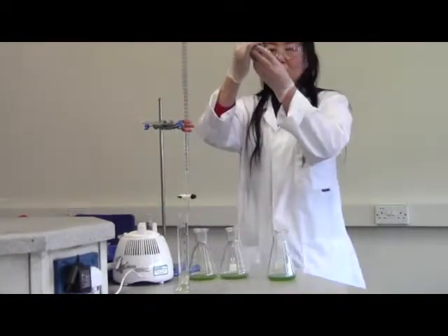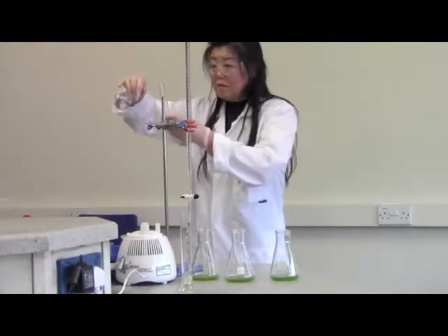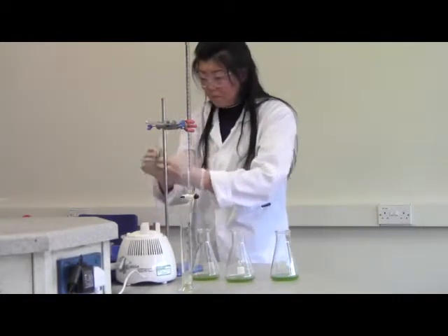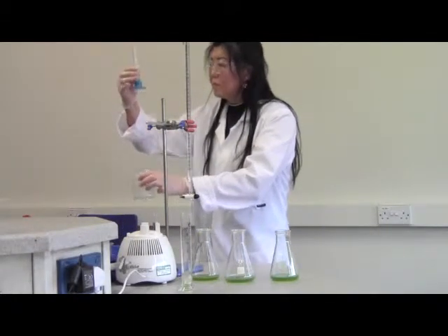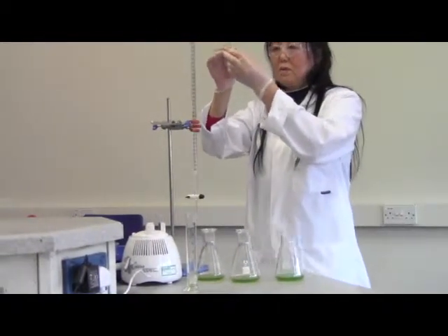Okay, this is second. This is the third. Five milliliter.